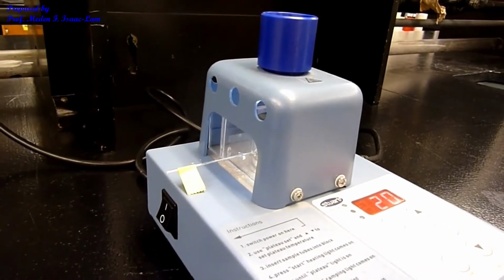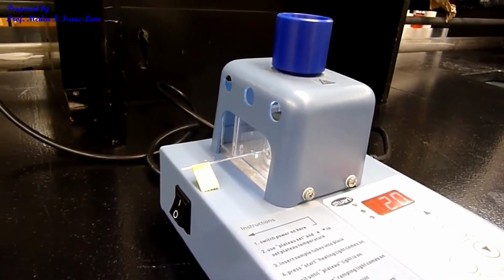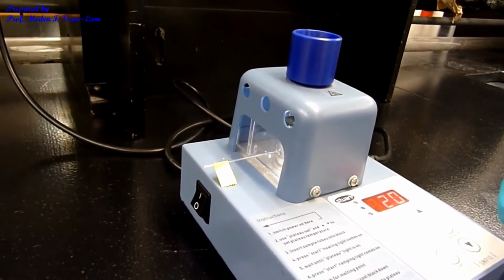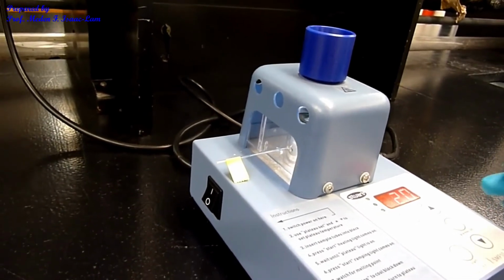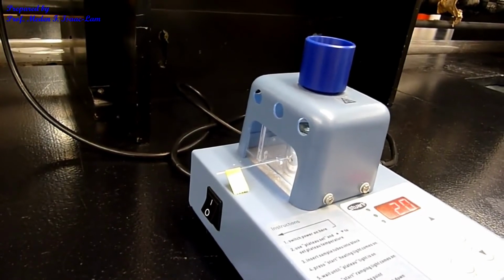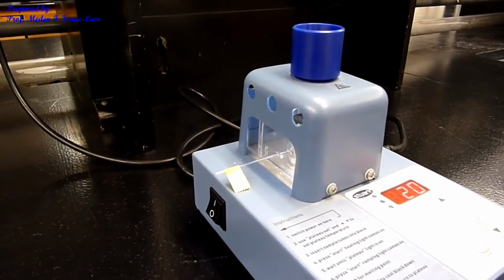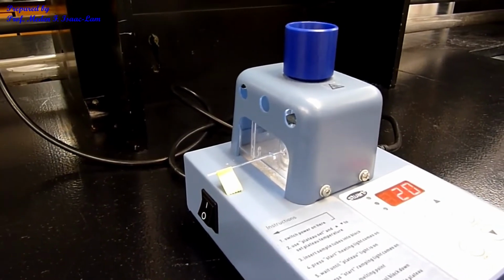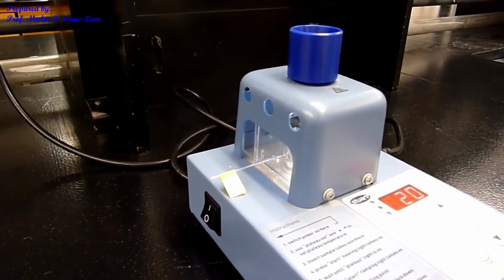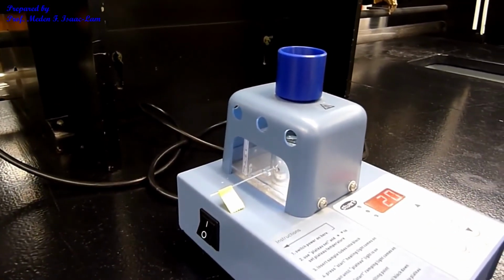So in the table of the combinations of different aldehydes and ketones, the lowest melting point temperature is 98, and then the highest temperature is 235. So you have to start at 98, you ramp it to 98, and then slowly increase it depending on the temperatures. You have to look at the numbers in the table so that you are not overheating it.